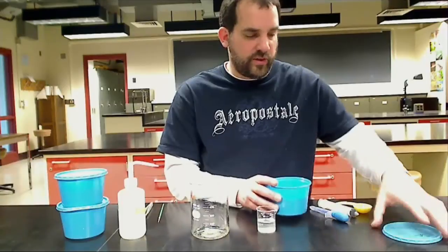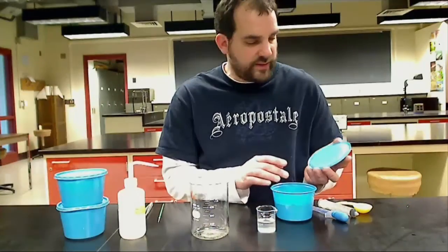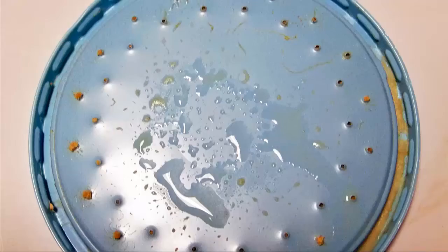When you take off the lid, nematodes should be emerging inside the cups, around the edges of the cup as well as on the lids of the cup.